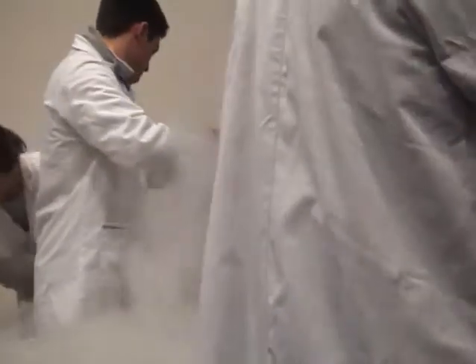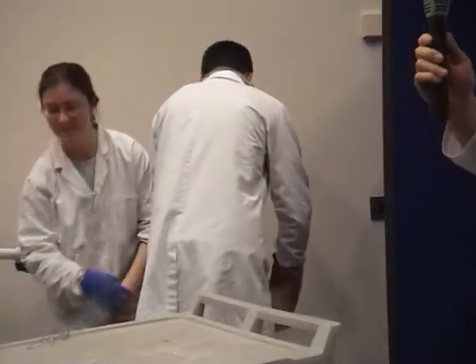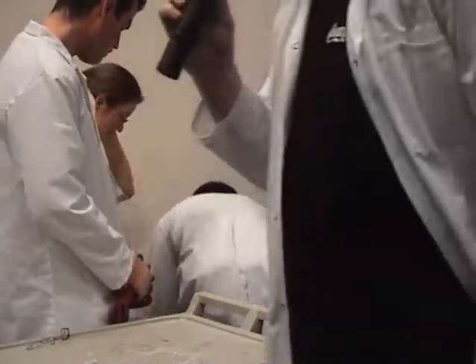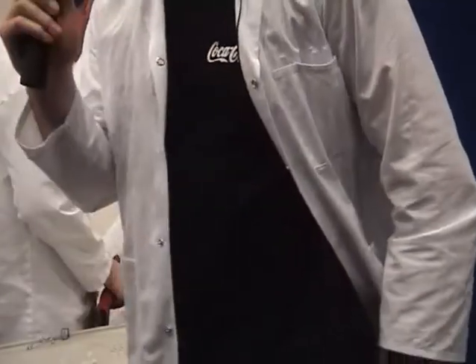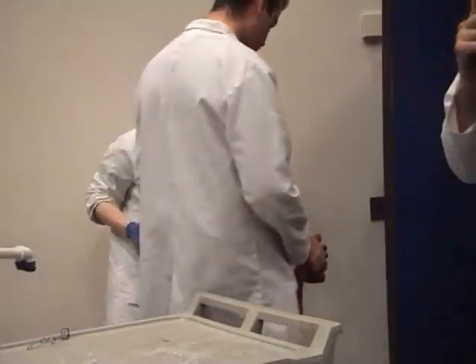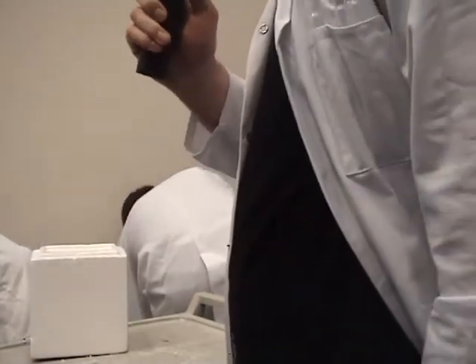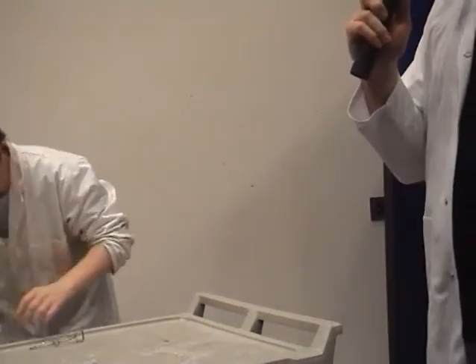Okay, next, so we saw some gas work there. Now, John and Fiona behind me have a demonstration set up, so while they're setting up, I'm just going to introduce what they're going to do. Basically, they're going to work with you on the properties of gases: how they react, how they work, if they float, if they fall. So that's what they're going to do. John, ready?